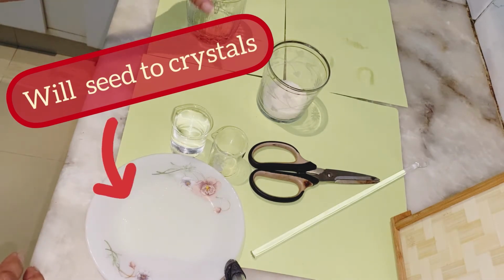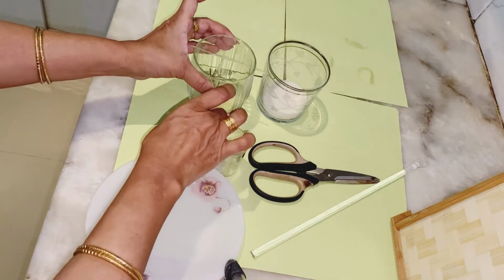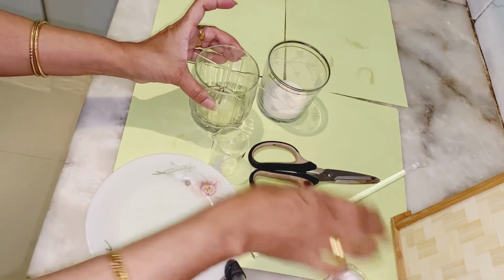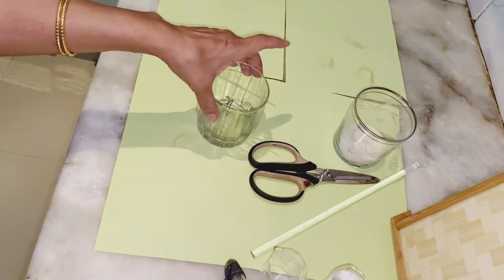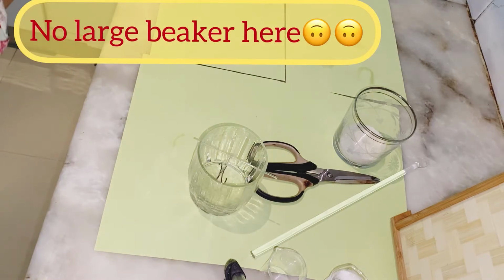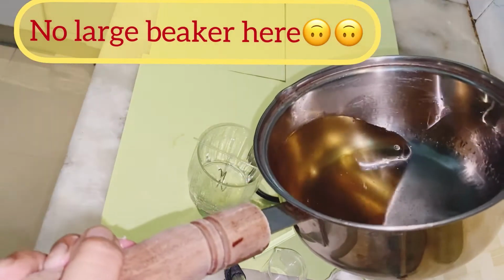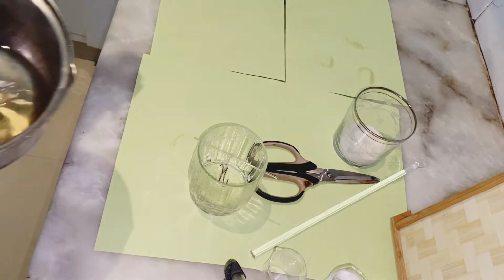Now I will put it like this over here. I'm going to add this solution. Be careful when you are handling it.